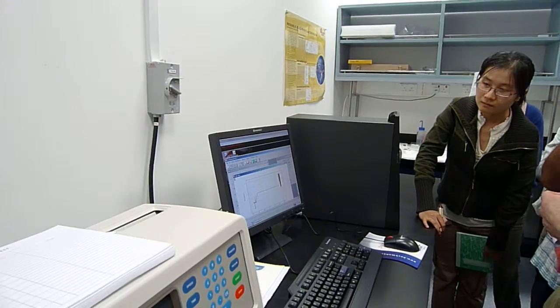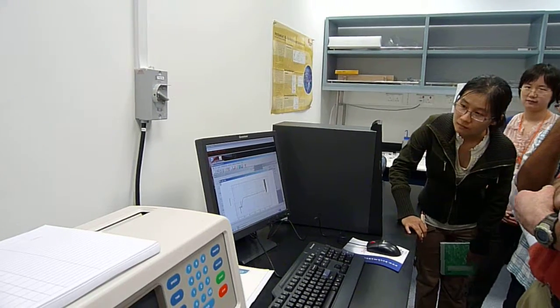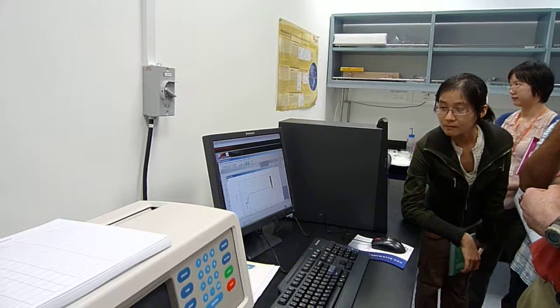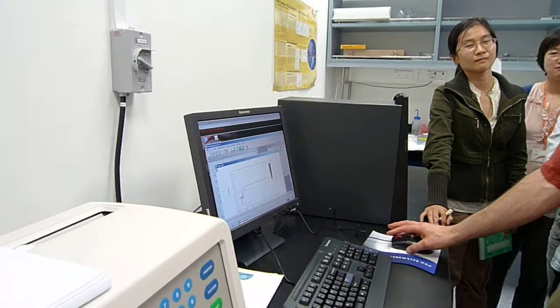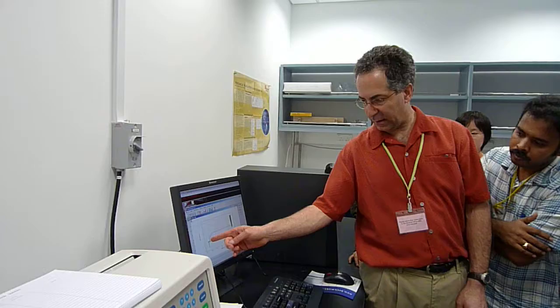And that's cell 1. And it looks excellent, I will say. Surprisingly good. No, I'm just joking. What I'm saying is that you can see the sample and reference. This is the reference meniscus. This is the sample meniscus. We loaded a little bit less.